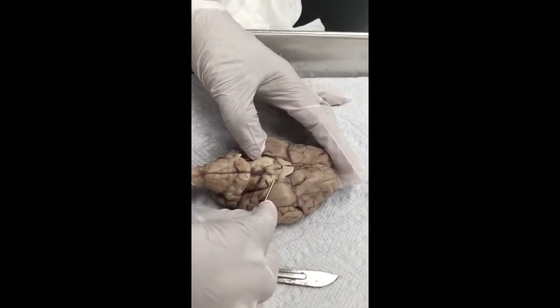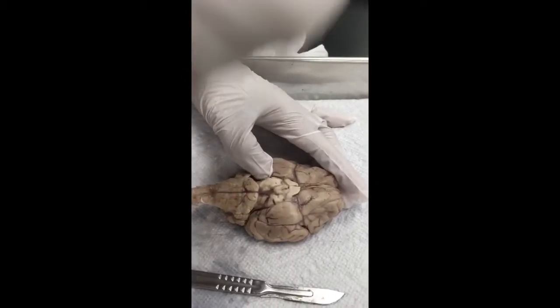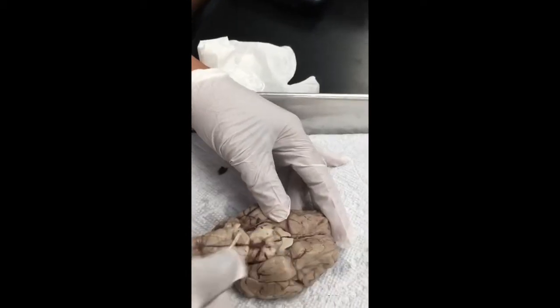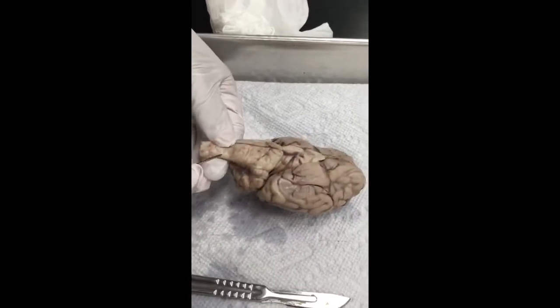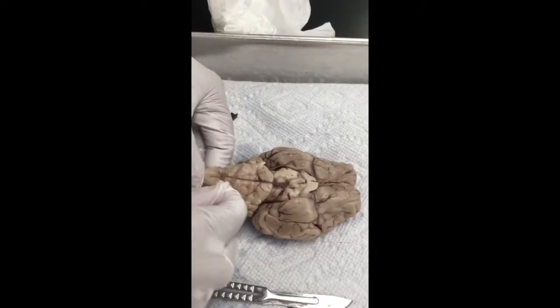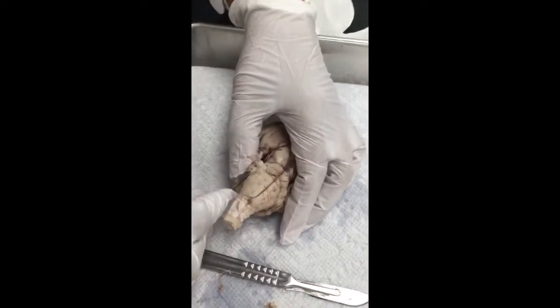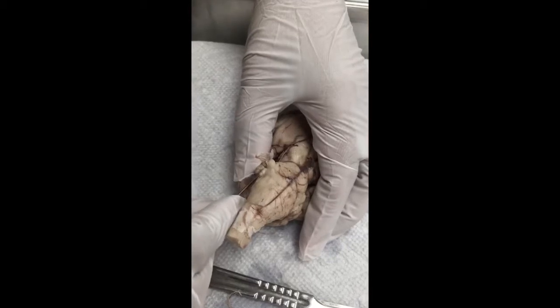And after that, we are going to go to the oculomotor nerves. The optic, oculomotor. Then I would go to the hypoglossal. Let me take this. Look at those nerves. Did you see those nerves? That's so good.